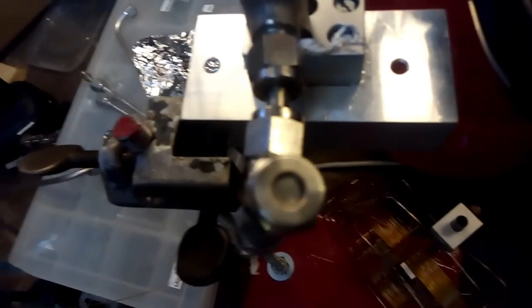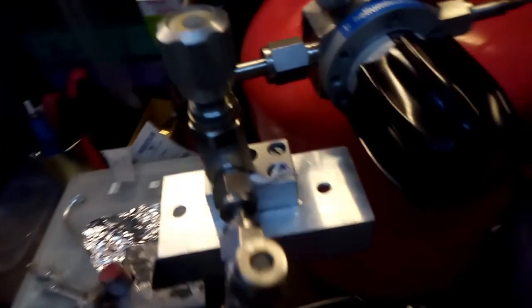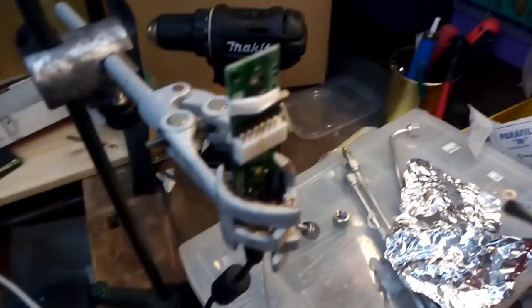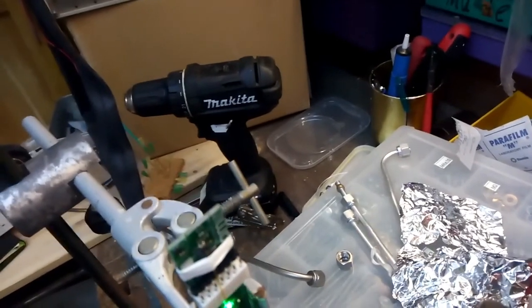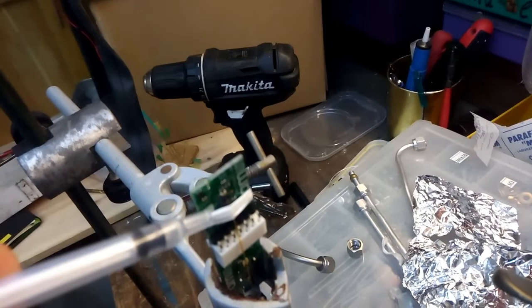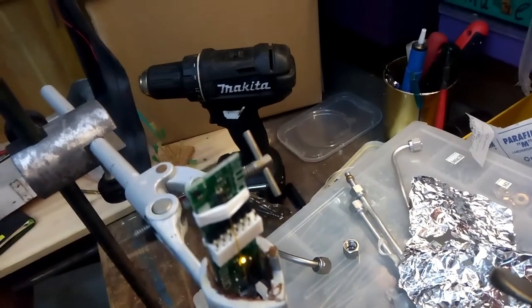The detector is a semiconductor gas sensor, which measures CO2 in the air and volatile organic compounds. And as I also said, it's necessary that there is a helium atmosphere around the sensor so that you don't measure any volatile organic compounds from your room or from your clothes or your breathing.